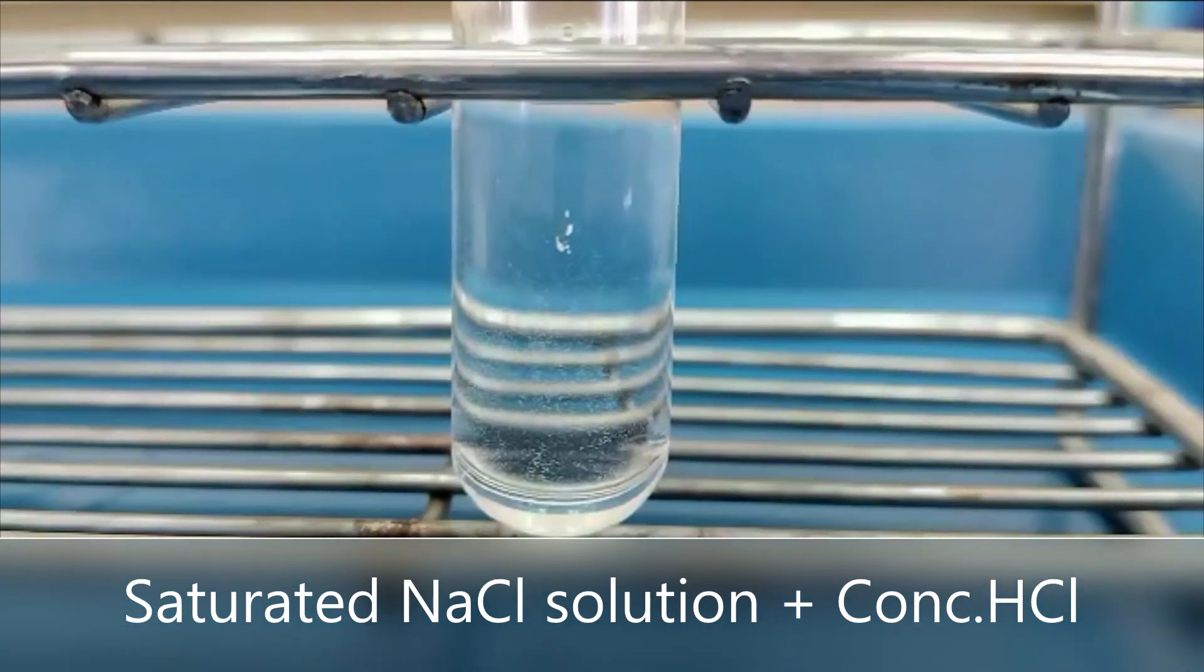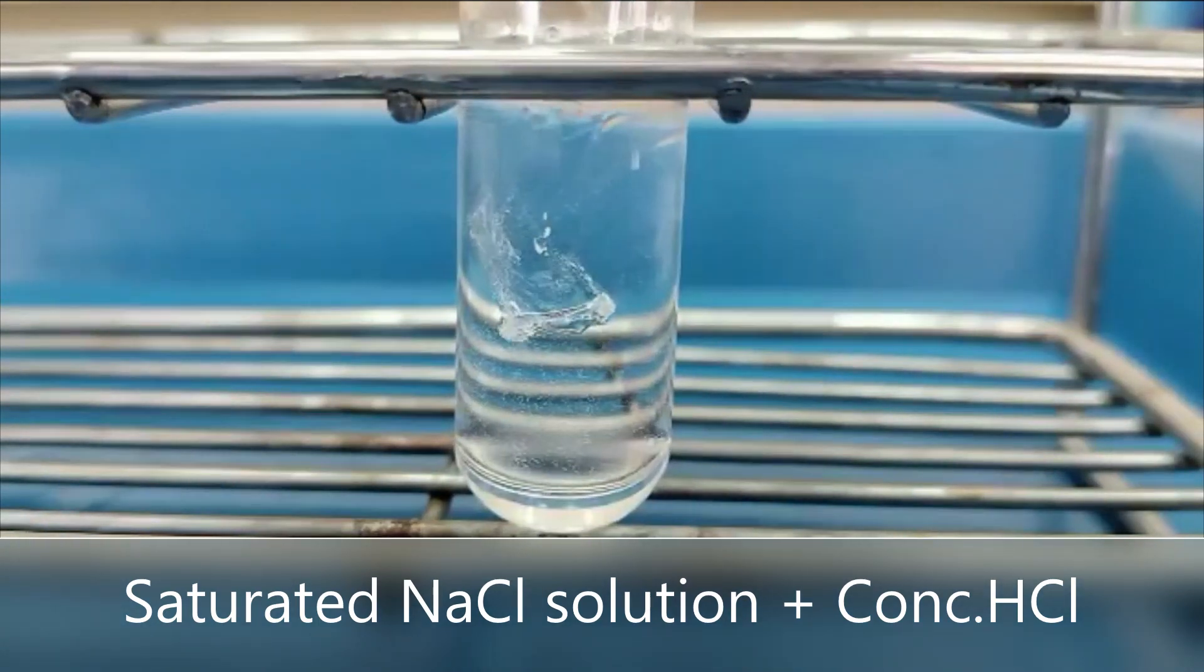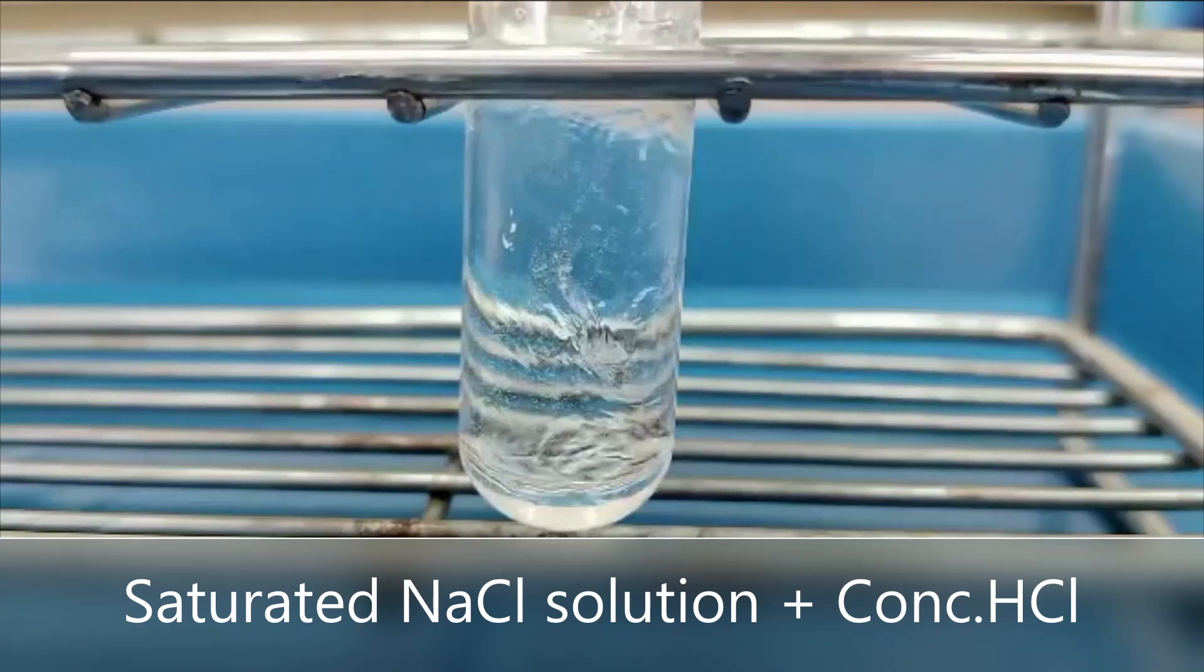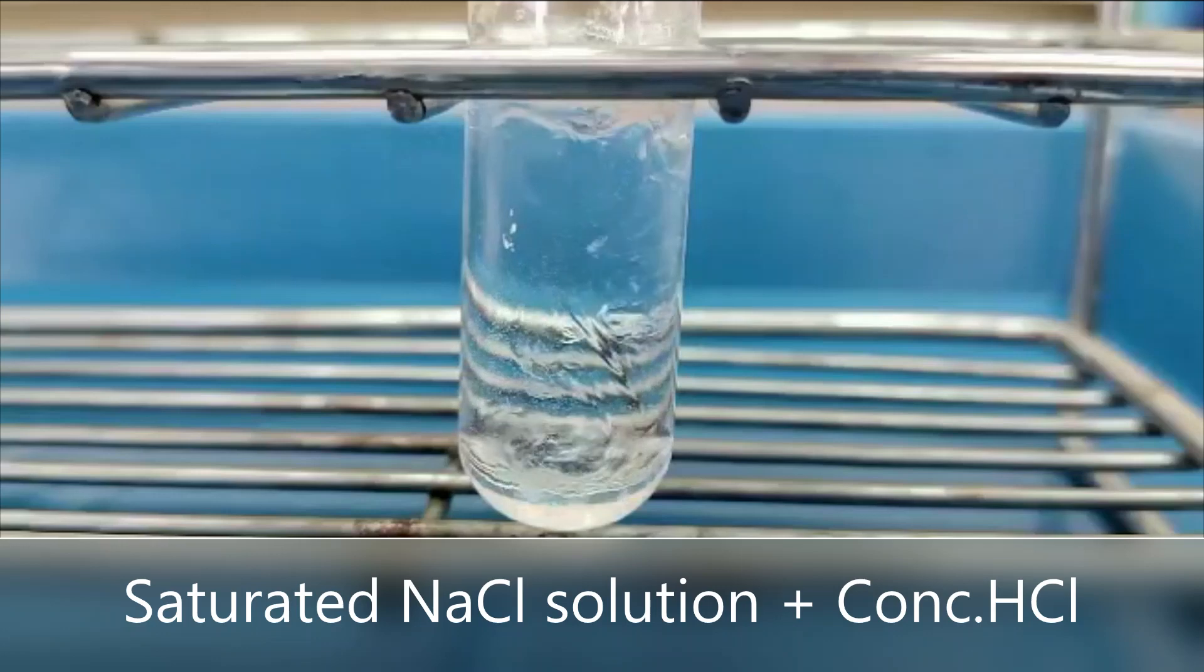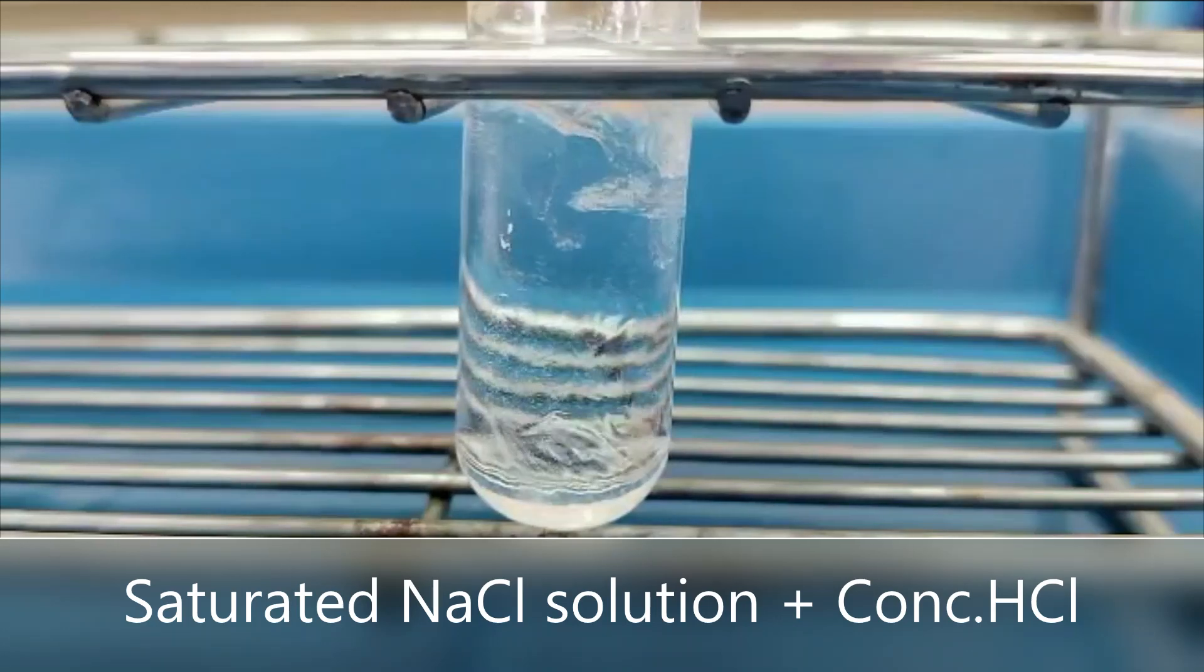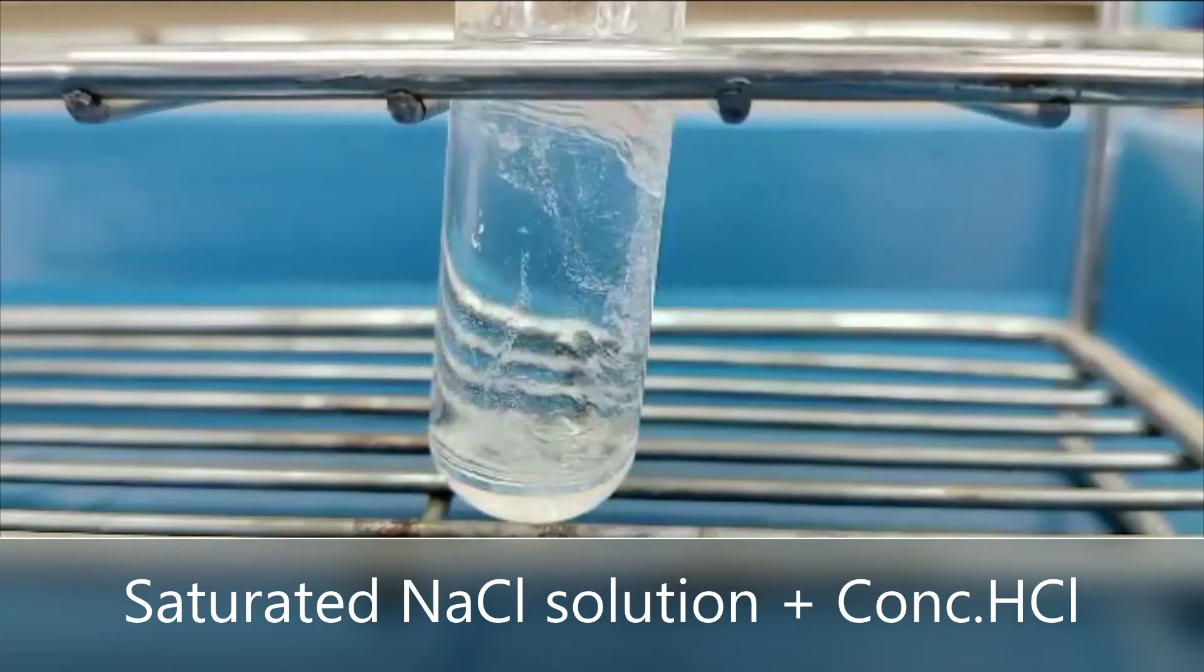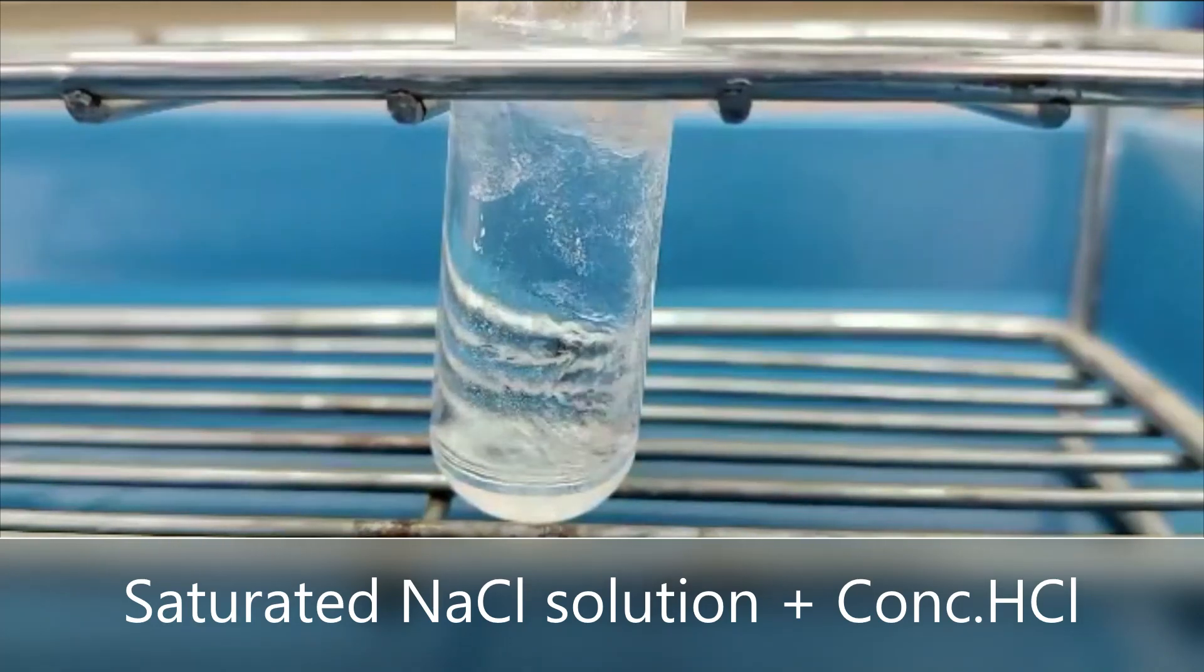Chemical equilibrium experiment: experimental method. Add 2 milliliters of distilled water to the test tube, then slowly add sodium chloride salt bit by bit. Shake to see if there is more dissolution. When the salt begins to become insoluble and there are remaining salt crystals that do not dissolve, add a little more salt.